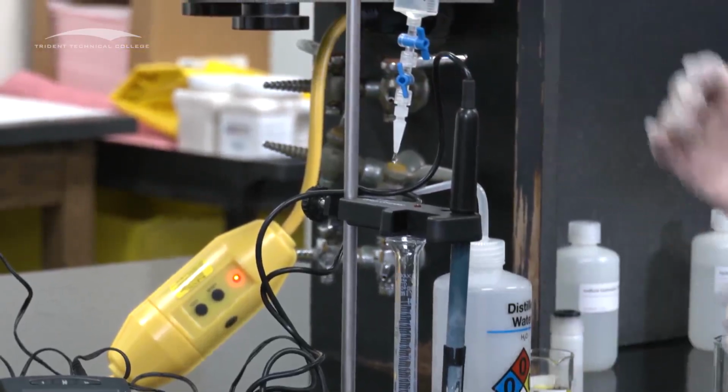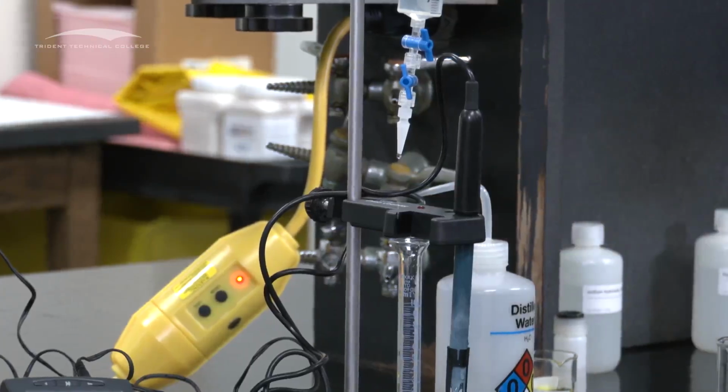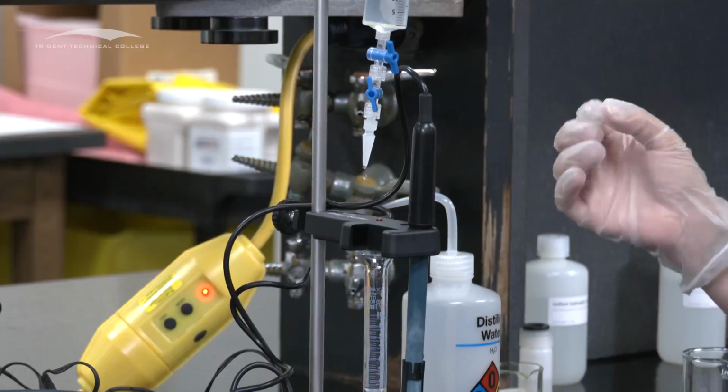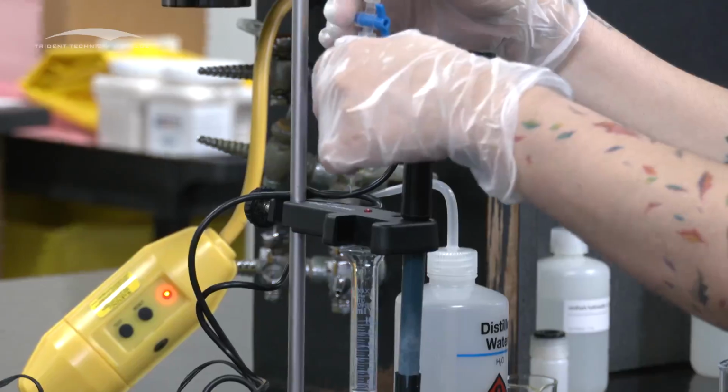All right, so right now, if you notice, I don't know if you can see it, but the light is not going off. It means that it's not reading. So you need to find it until it is reading. So now you should see my little blinky light. It's reading.